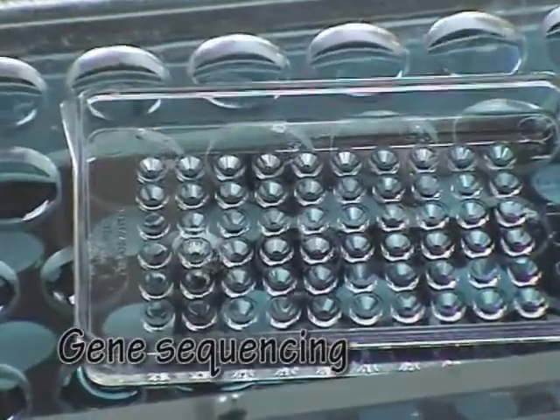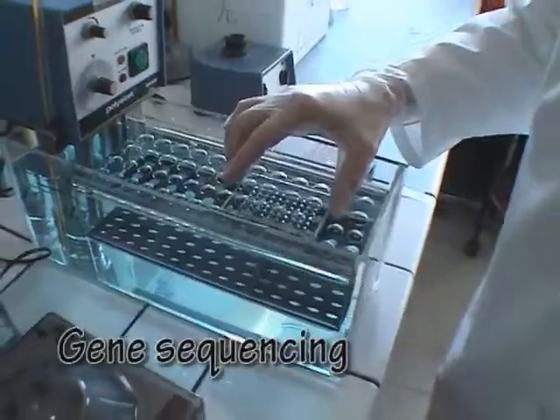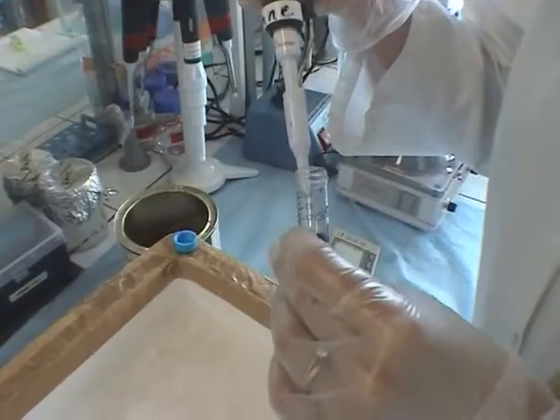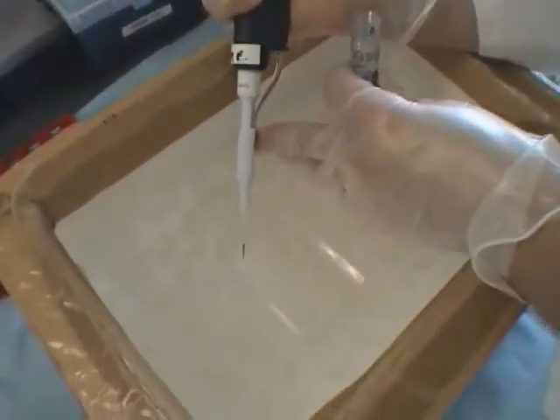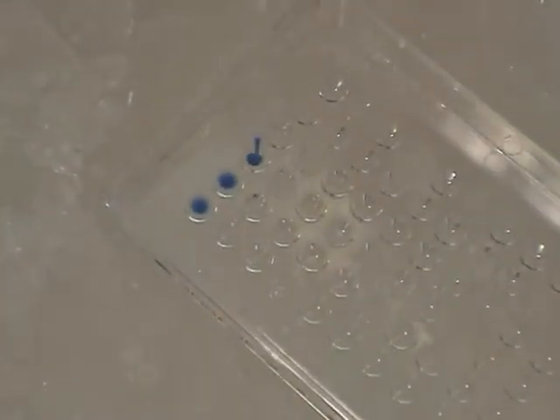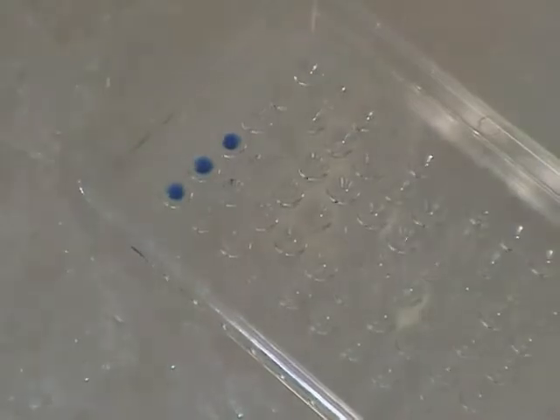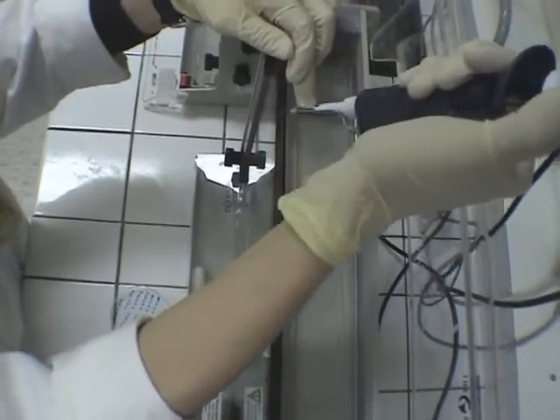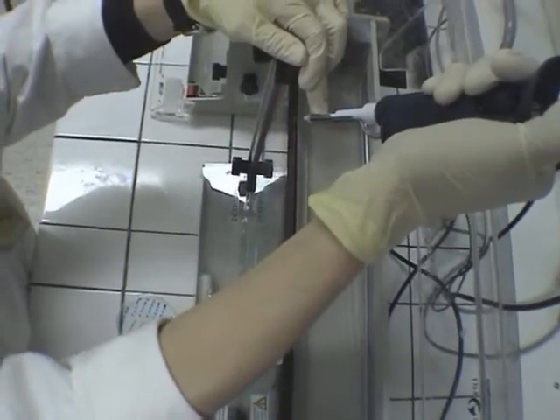To check that the gene really is present and intact inside the cells, we perform a sequence. The plasmid is extracted from the bacteria and its sequence is analysed on a gel.